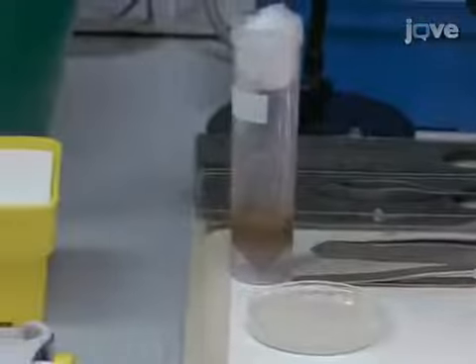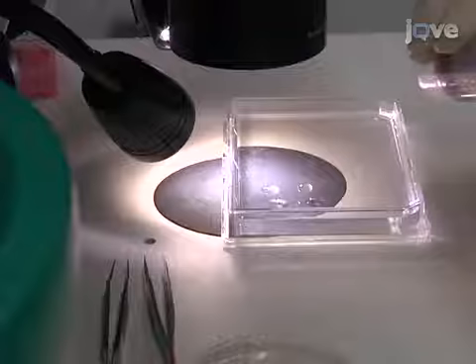First, assemble the necessary tools, solutions, and a vial of wandering third instar larvae. Keep the PBS and fixative solutions on ice.